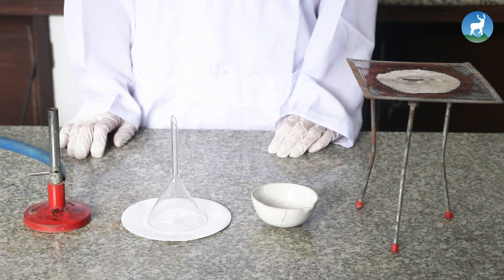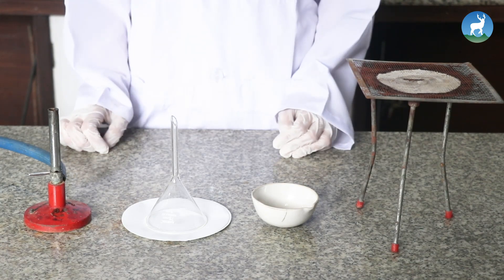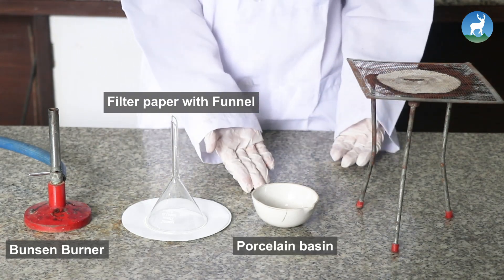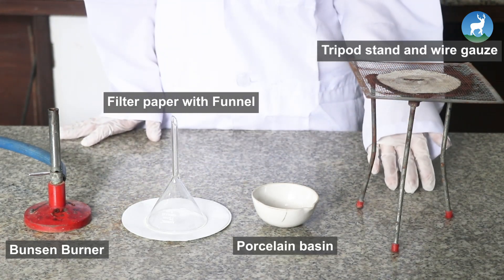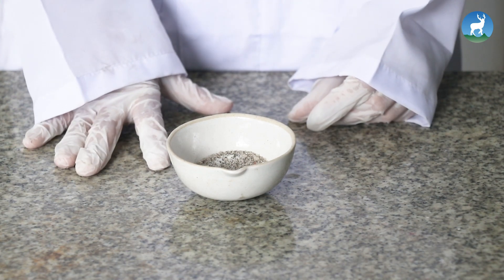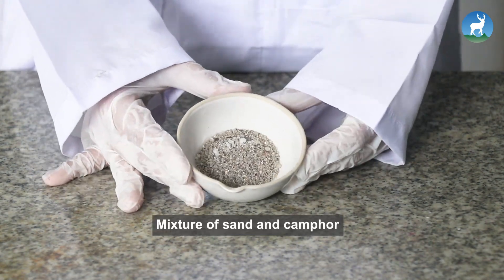For this experiment, the apparatus required are a Bunsen burner, filter paper with funnel, a porcelain basin, and a tripod stand with wire gauze. The chemical required is a mixture of sand and camphor.